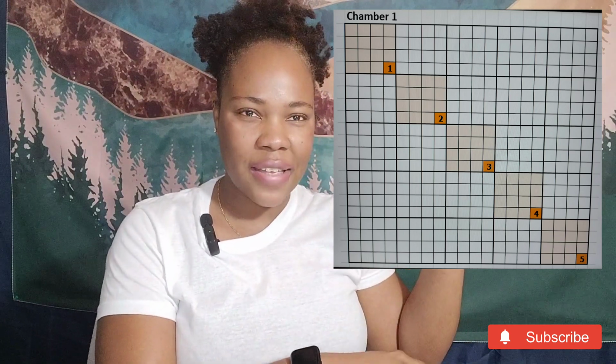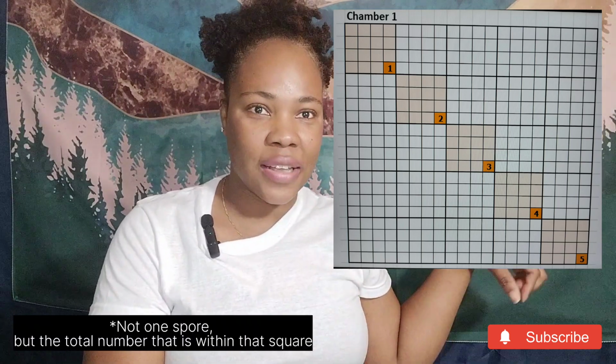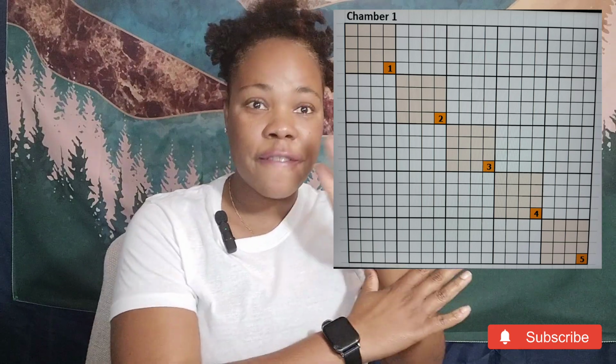So in chamber 1, we count on a diagonal, and within those 5 large squares on the diagonal, we choose the small ones at the very corner. So what is at the bottom right? And then we count the spores in each of those small cells. So at the end, I should have 5. The cells that I count spores in are bolded, have a brighter orange, and have the numerals 1, 2, 3, 4, 5 in them.